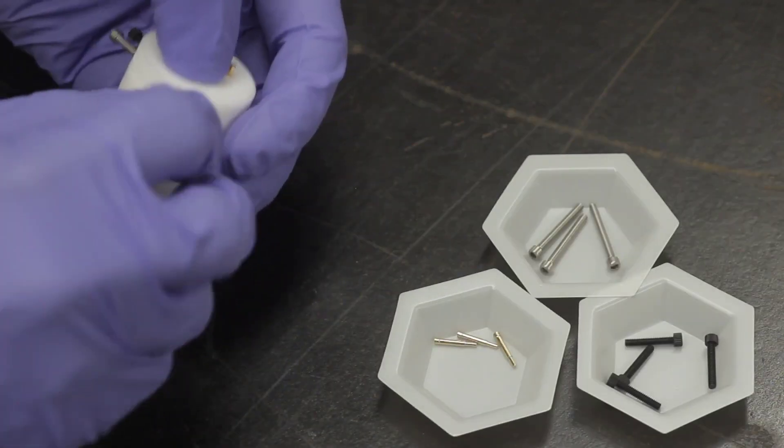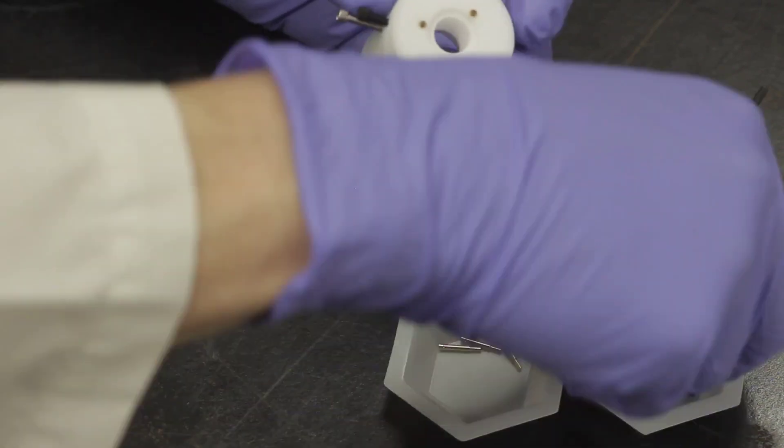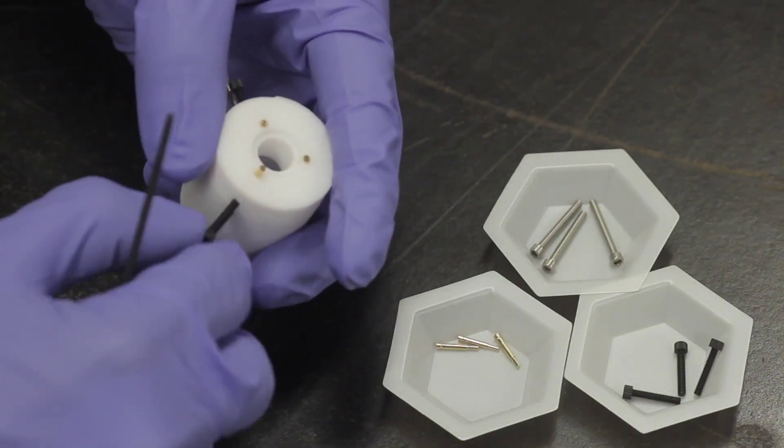While depressing each pin with a finger, install a nylon screw into the lower hole. This screw will hold the pin in place during the remainder of the assembly.